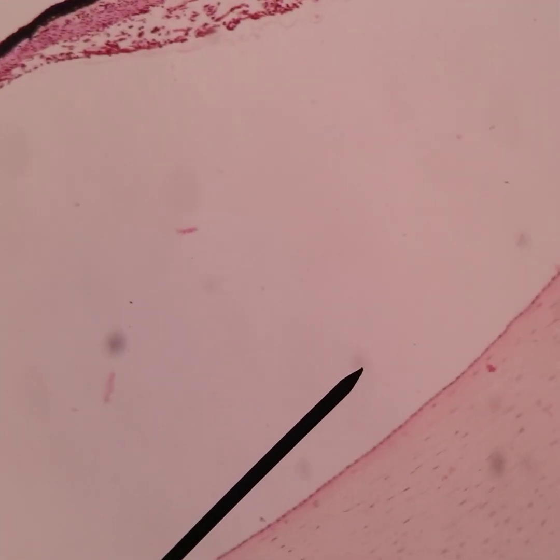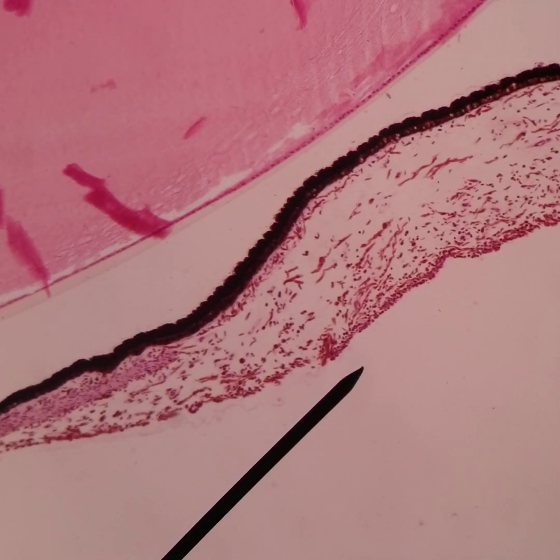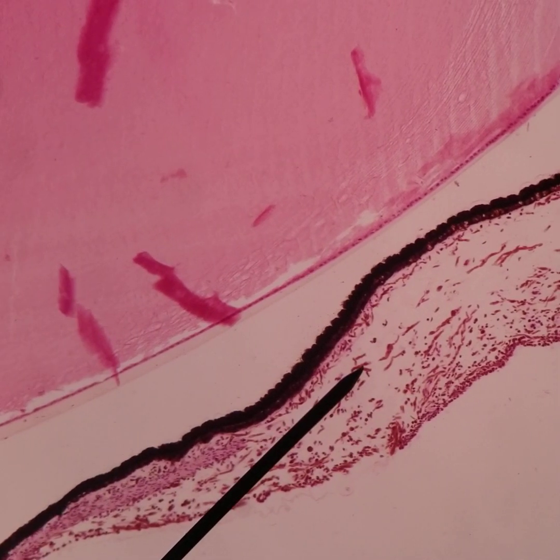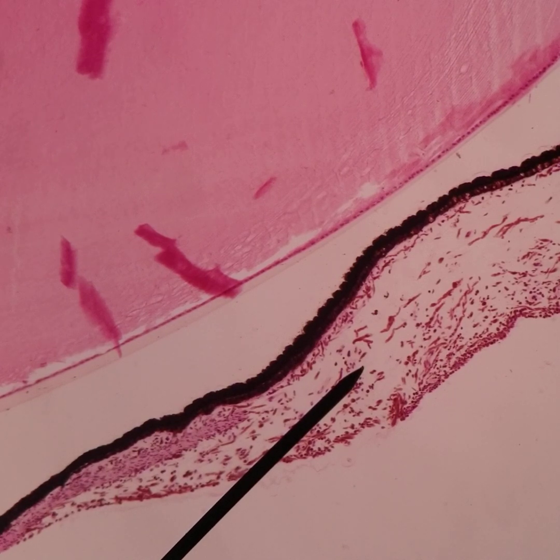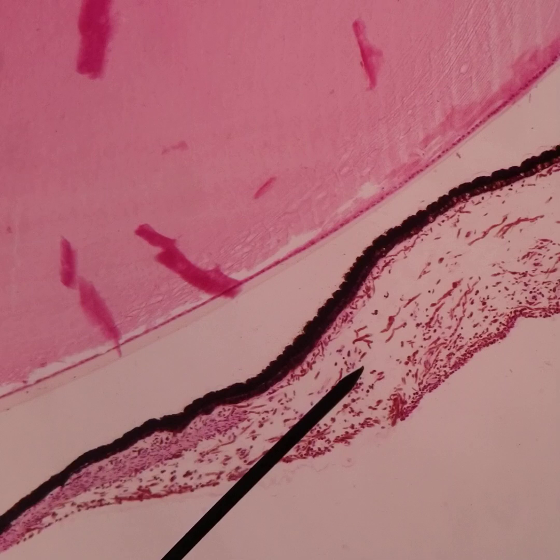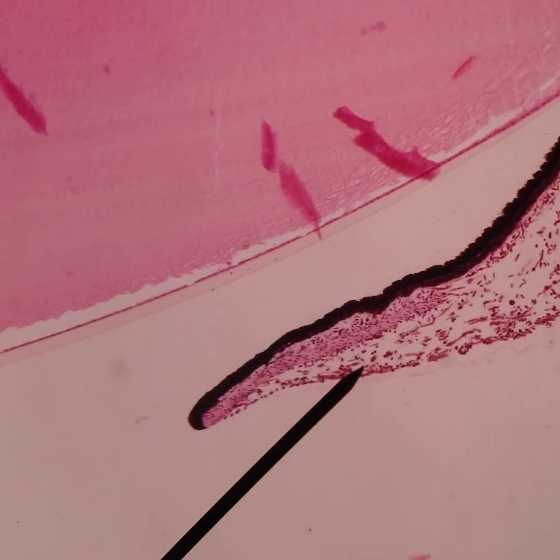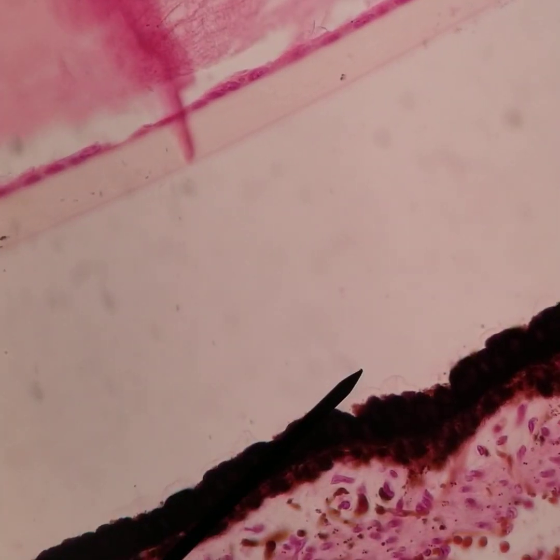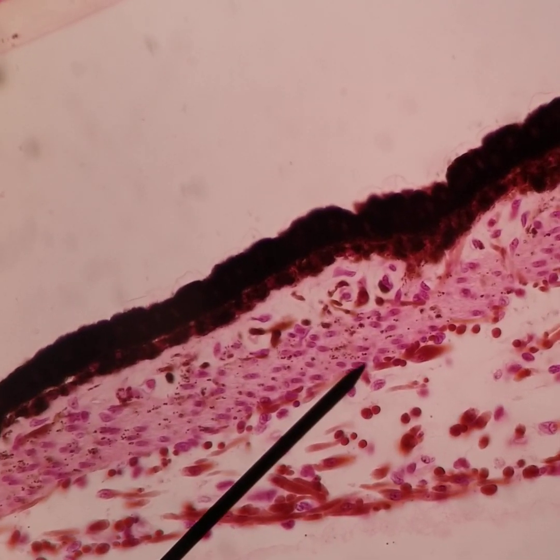The anterior border layer is densely populated, then the stroma is a looser connective tissue with trabeculae and more intricate intratrabecular space. The iris sphincter muscle is in the pupillary region — it doesn't run the full length of the iris but is in that stromal region, visible right here near the pupil margin.